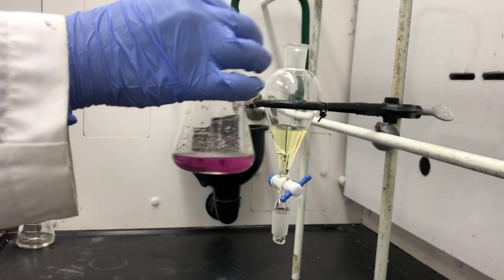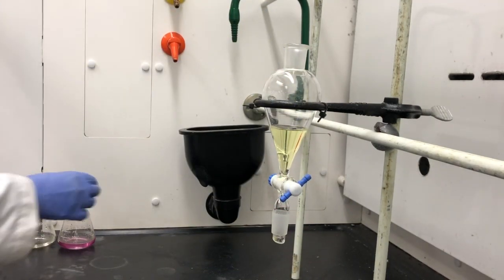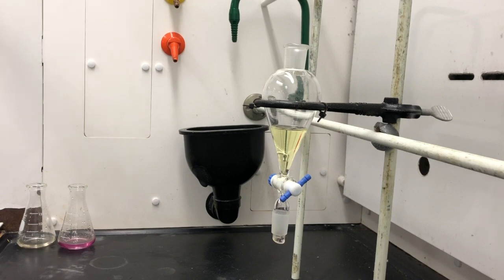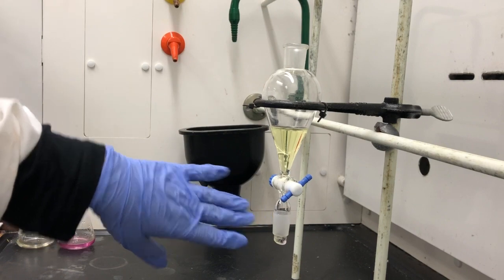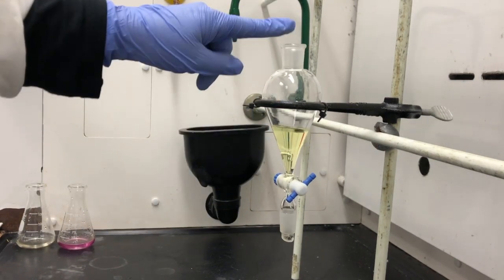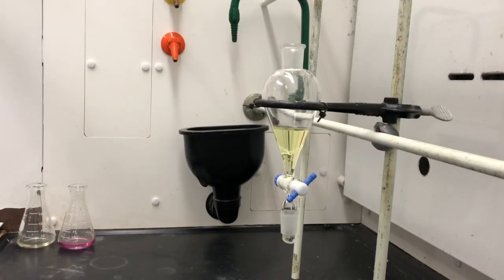And again, we'll save this, this is our second aqueous layer. Now, anytime you want to dispense what was originally the top layer, you want to dispense it from the top. We always dispense the bottom layers from the bottom and any layer we have on the top, we'll dispense it from the top.